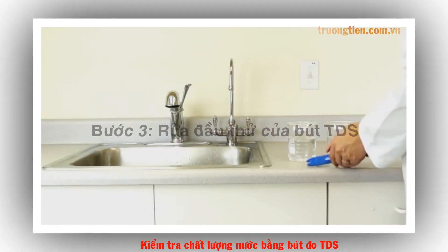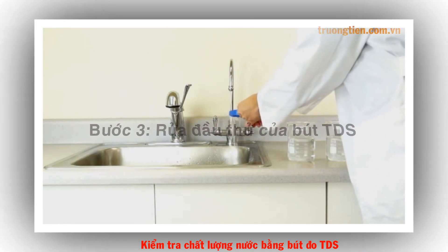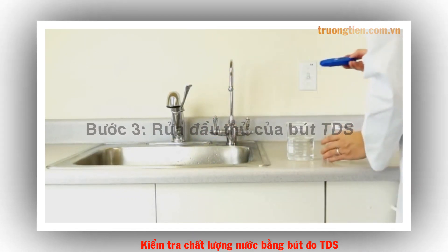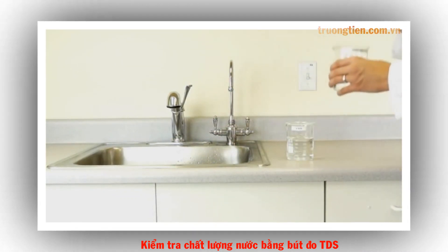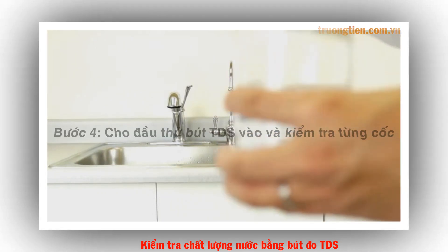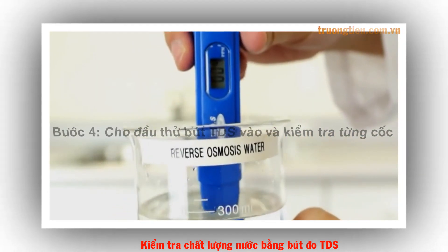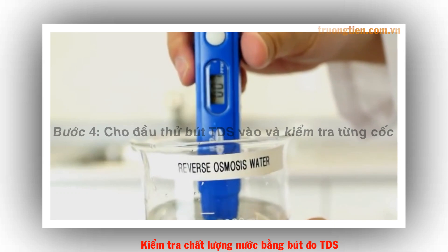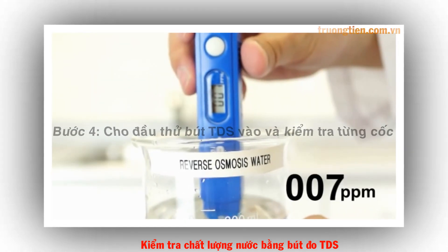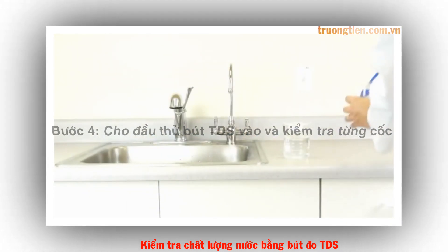Next, rinse your TDS meter with reverse osmosis water to maintain accuracy. Place the TDS meter two inches into the water until the meter displays a constant figure. The meter shows seven parts per million for the RO water.